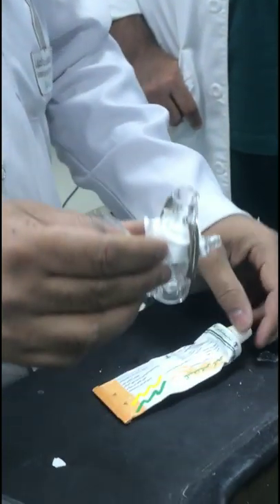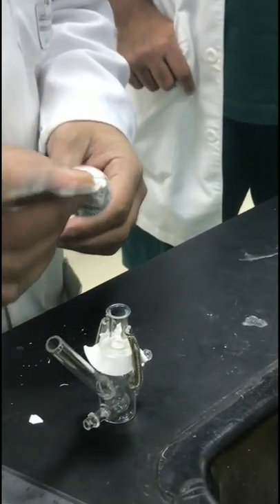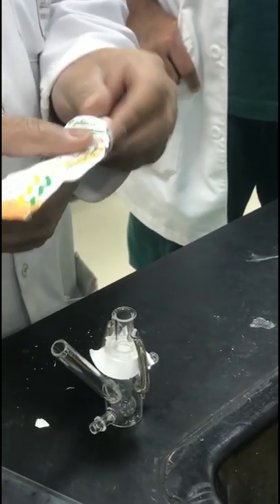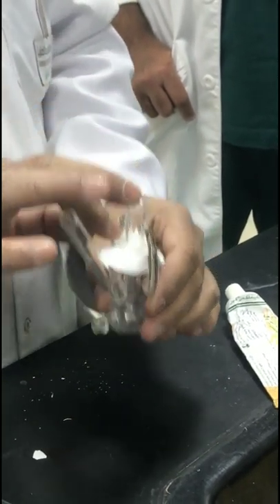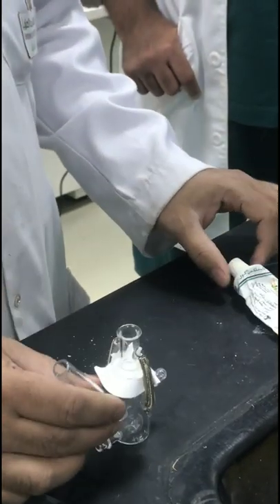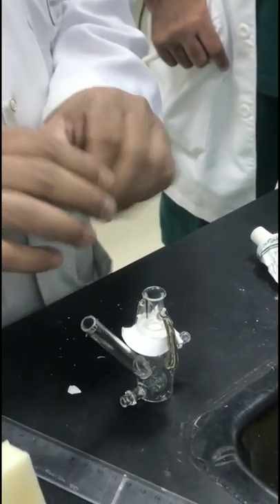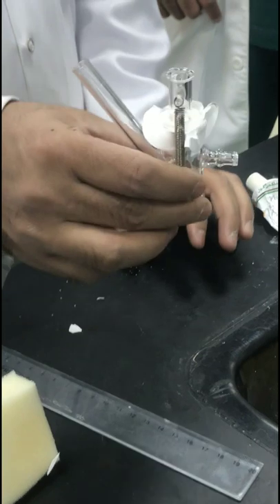For weighing: first take the weight of the whole assembly. Then measure the liquid and take the weight of the whole assembly again. Add the drug — maybe 0.25 gram or half a gram — then re-weigh to determine the exact weight of drug placed. This gives you the actual amount of drug applied.